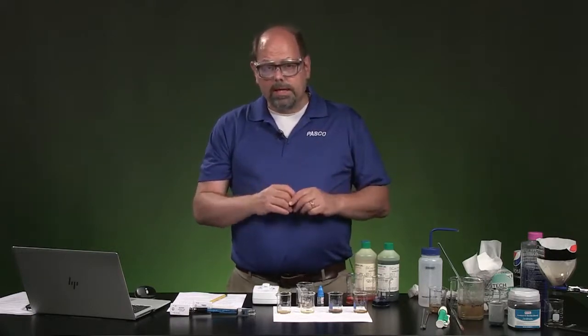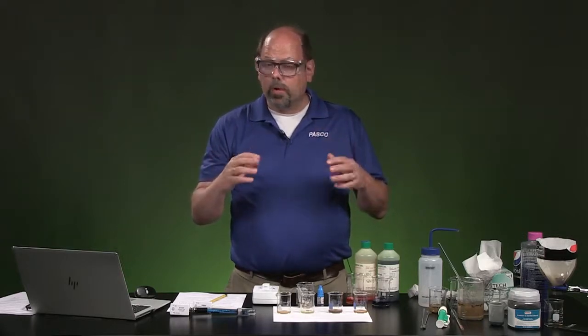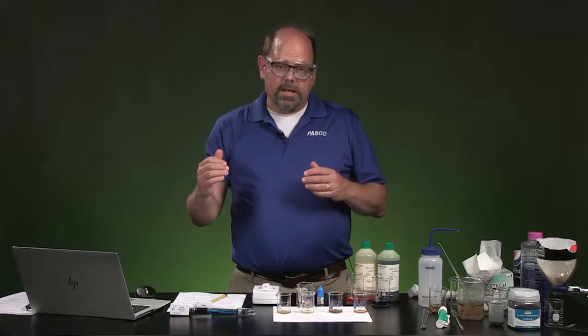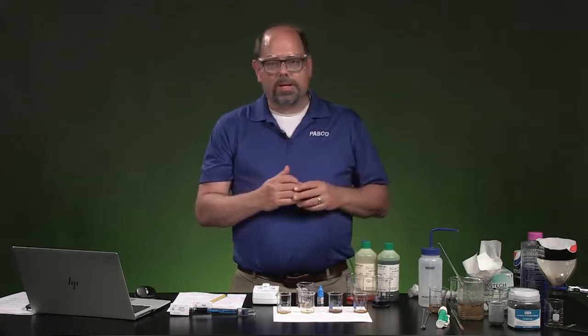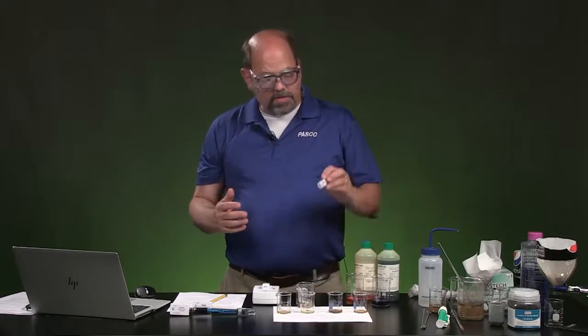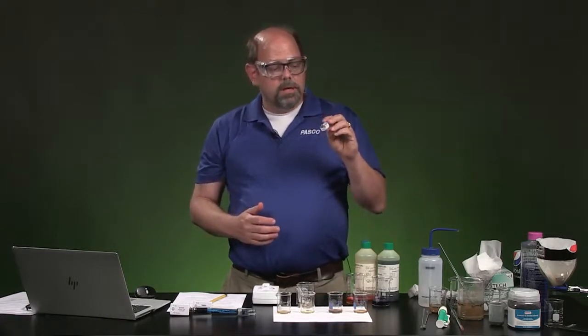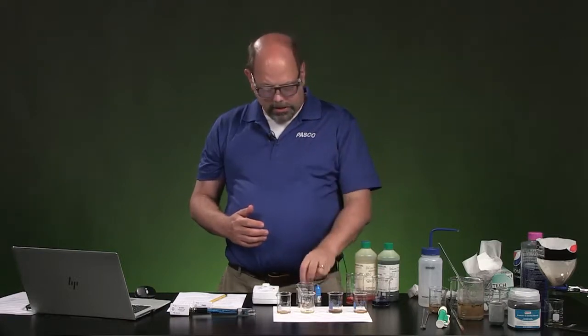We're looking instead at whether it's cloudy. In other words, if the light itself, not caring if it's red or yellow or green, if the light of all of those colors coming through gets somehow blocked out. So what we're going to use is a sort of standard solution. We're going to tell it this is a known amount of cloudiness. This is sort of a white, milky substance.